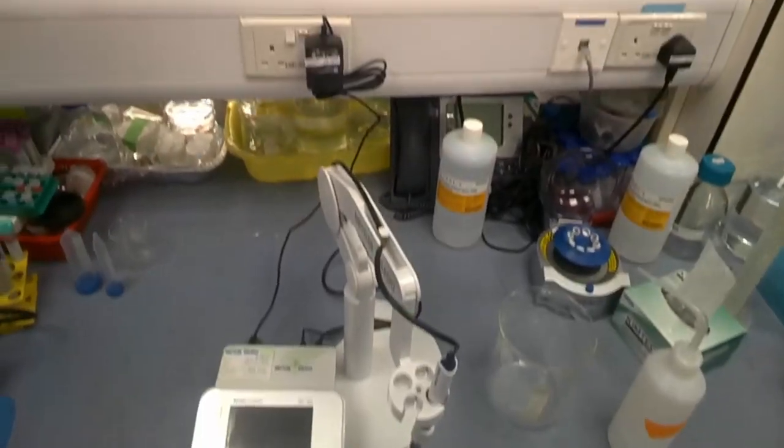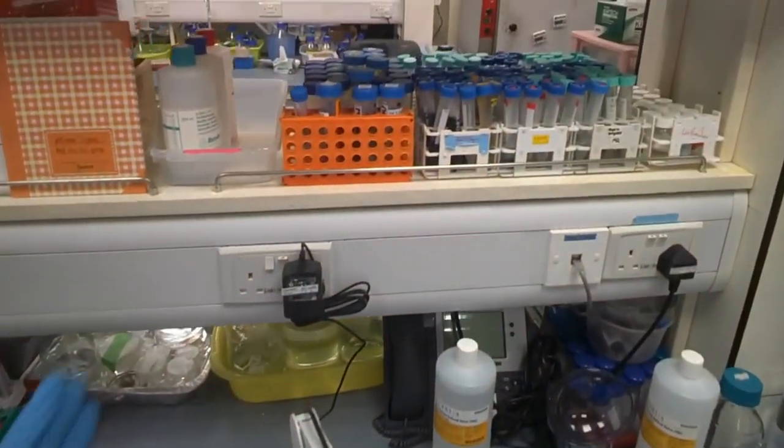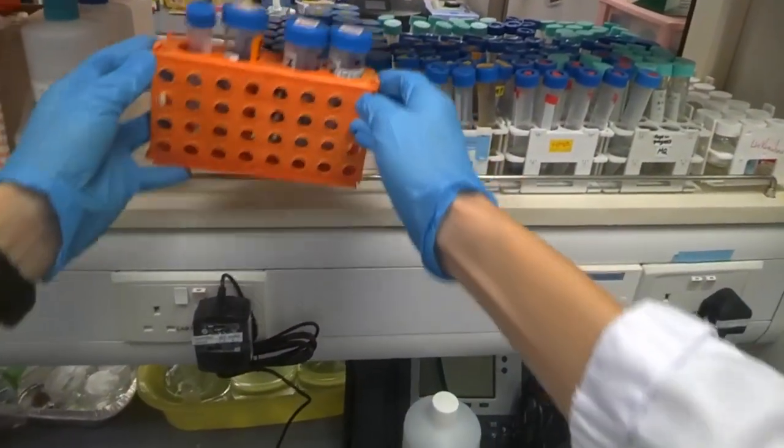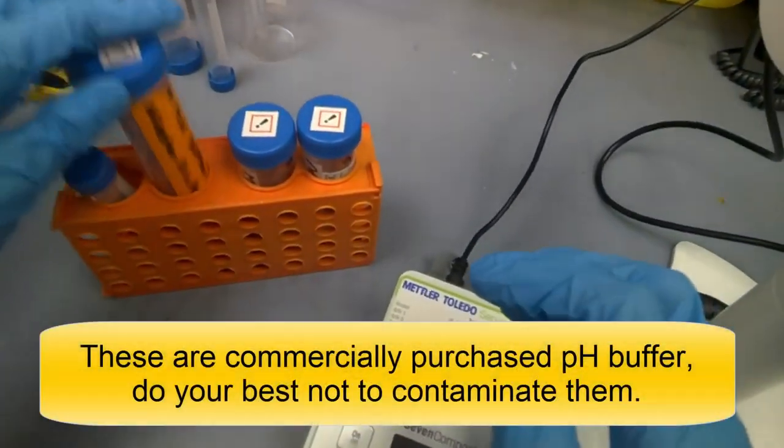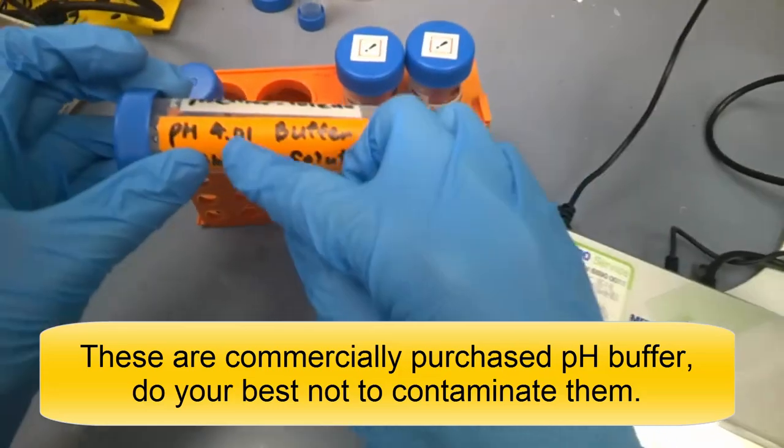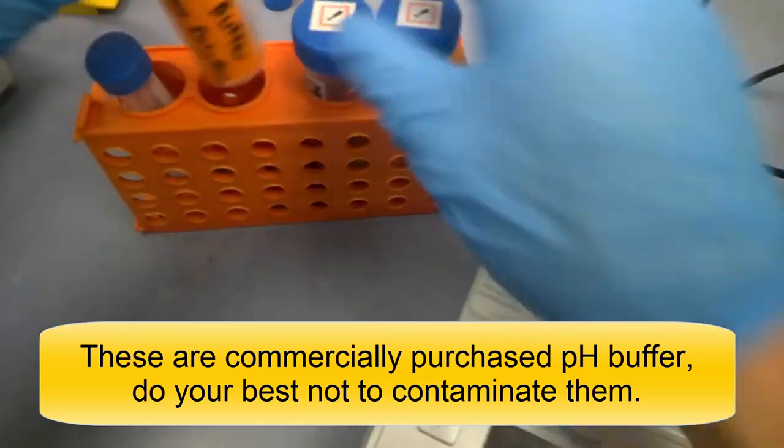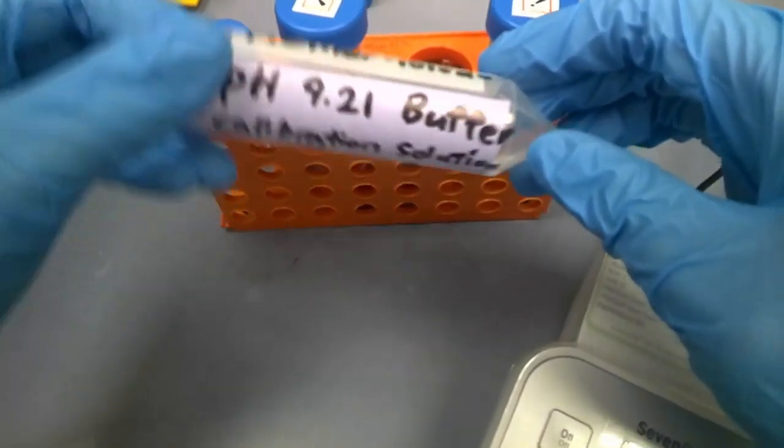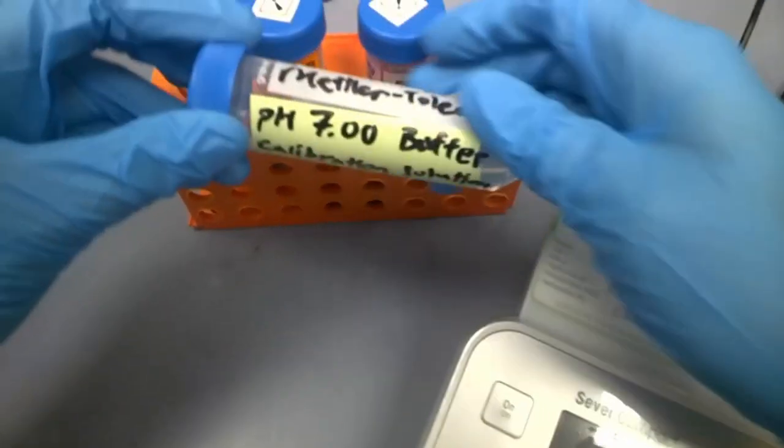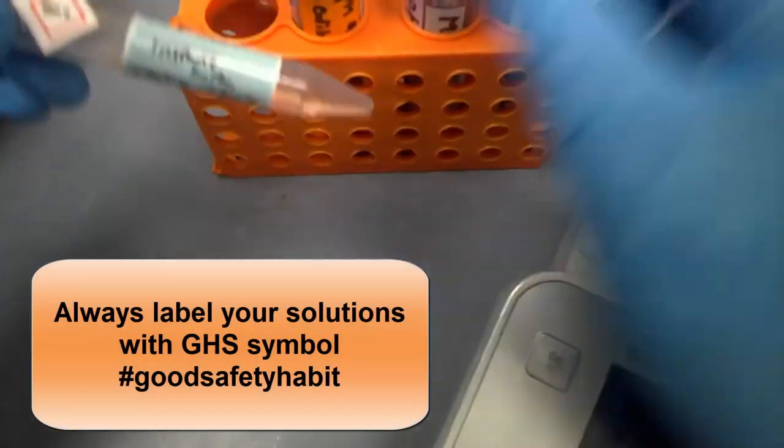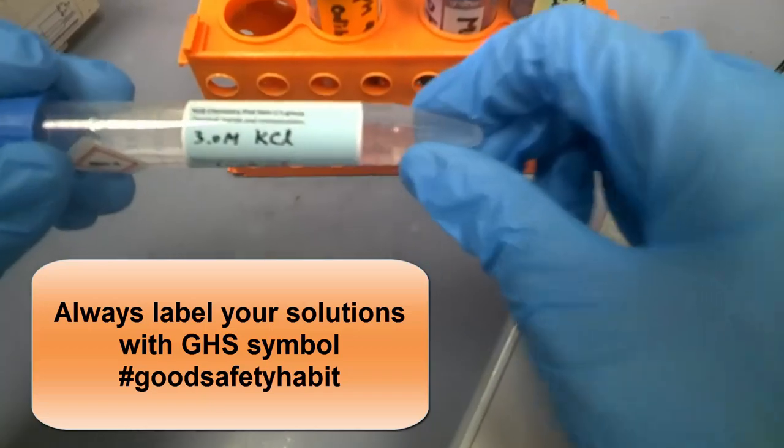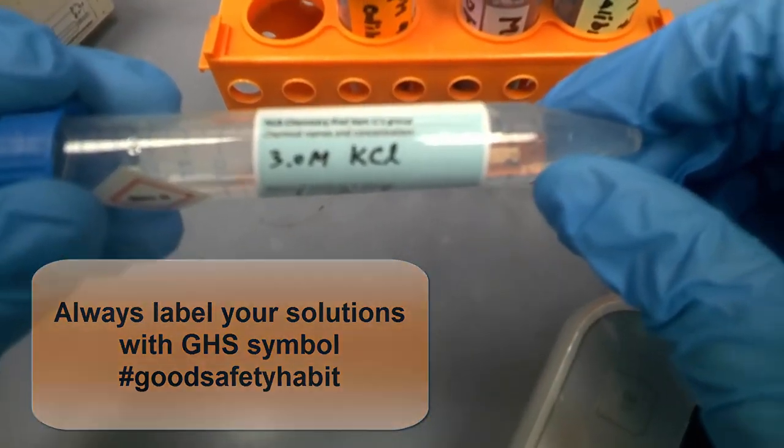The buffers are actually located right in front of you, above, over here. So I've placed the buffer, there's three of them. Let's examine them carefully. We have the pH 4.01, pH 9.21, and the buffer for pH 7. And what is this solution here? This is actually your 3.0 molar KCl, which is used to store the pH probe.